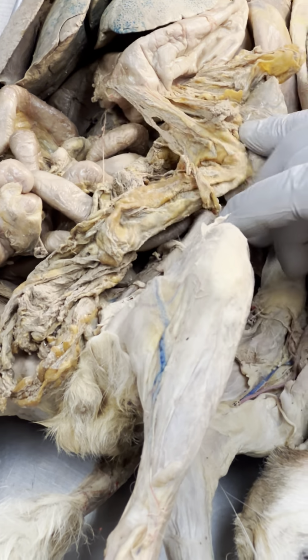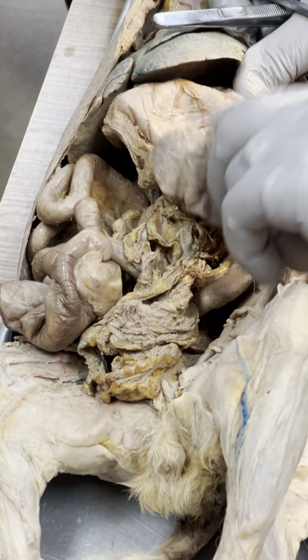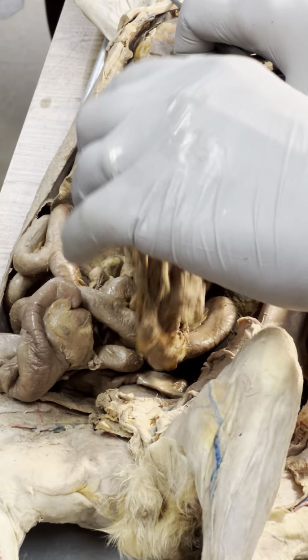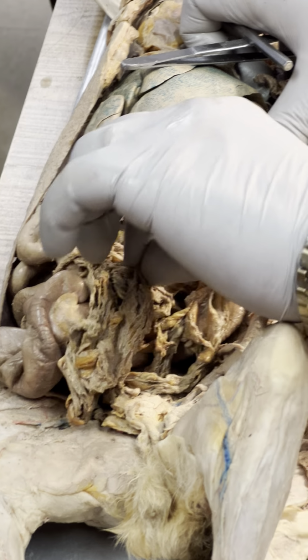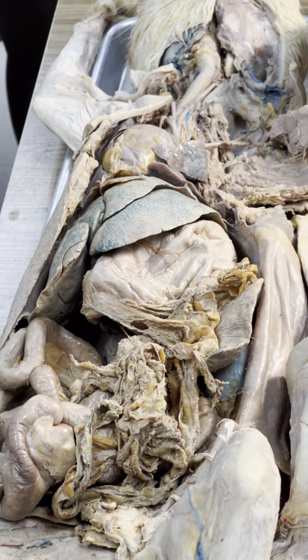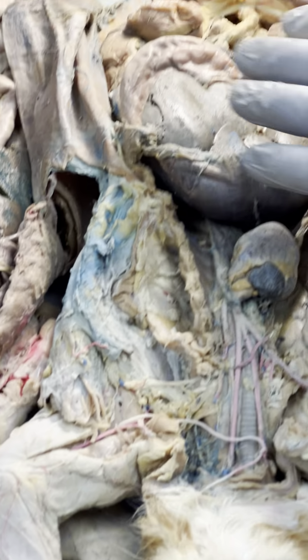Why is that greater? Because it's kind of hanging off the stomach here. We will have a better specimen than that. These cats have been opened and closed so many times by, how many classes are we at? There's like 7 different classes, and we all share these cats, so. All right, so don't forget greater omenta. We don't do lesser.